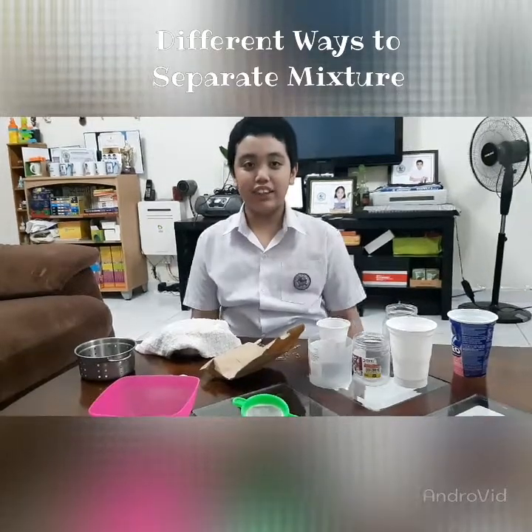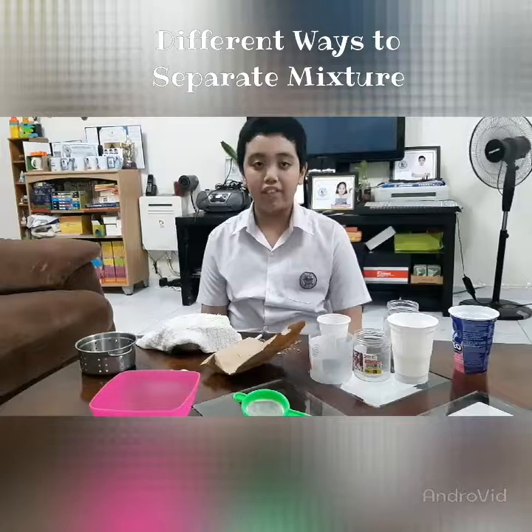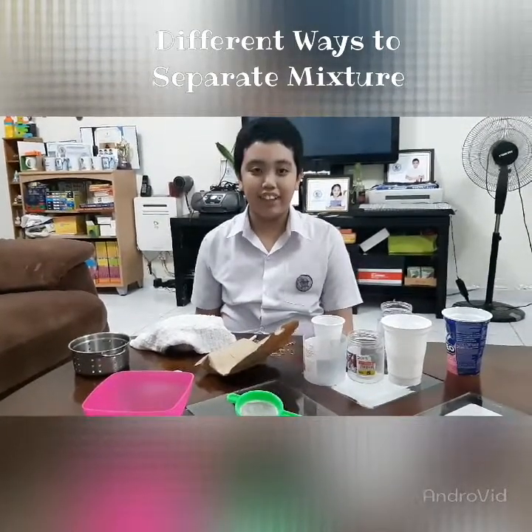My name is Patrick Luis A. Serratos from 6P Malawi. Today I'm going to show five types of mixtures which I'm going to separate.